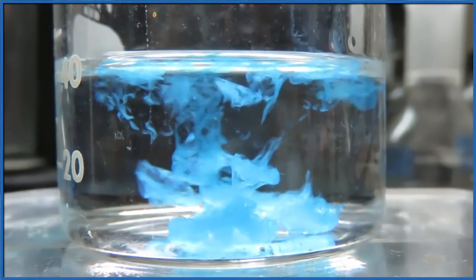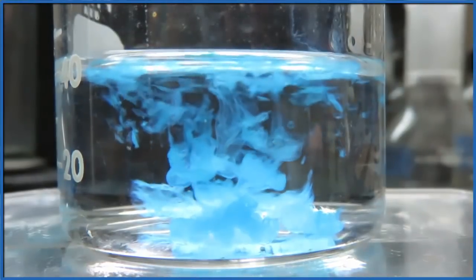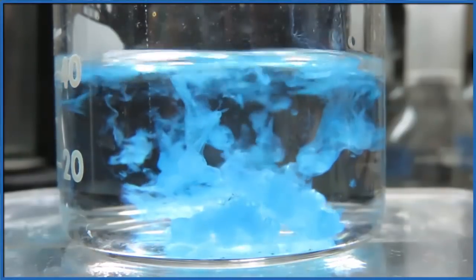And you can see when the copper sulfate hits the sodium hydroxide solution, it forms this solid, this precipitate that falls to the bottom.